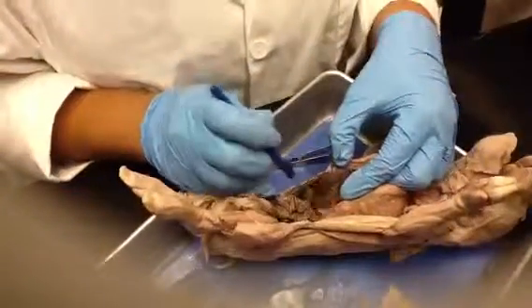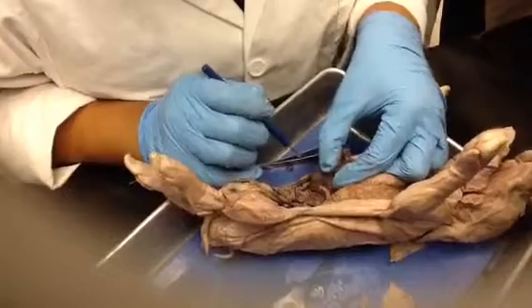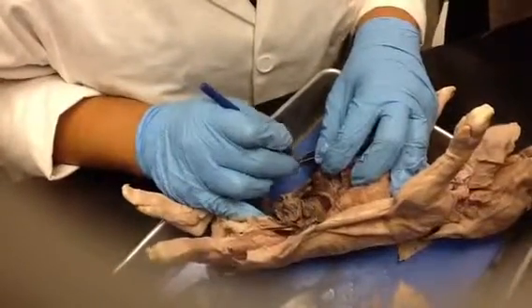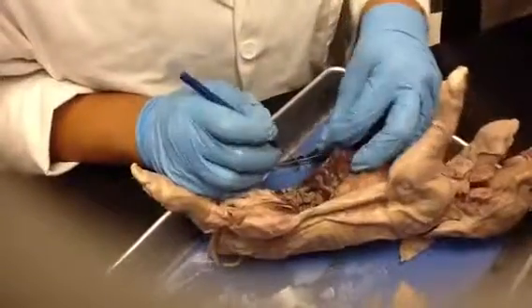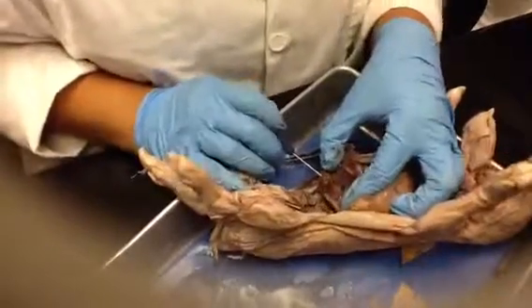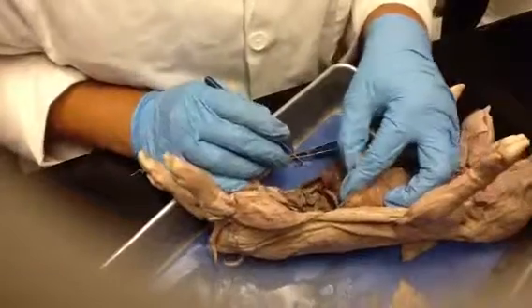The gallbladder is going to be on the underside of the liver, usually the part that's kind of softish, right there. You can usually see it. It's greenish. It has a greenish tint to it. See that it has a greenish tint to it? Yes. So the gallbladder is fused to the underside of the liver.